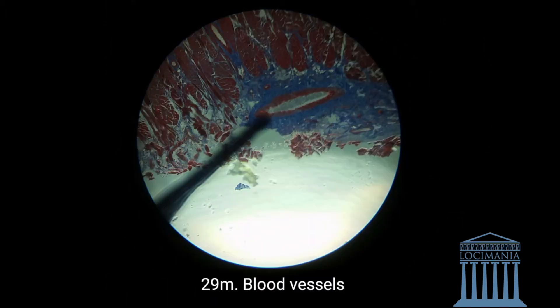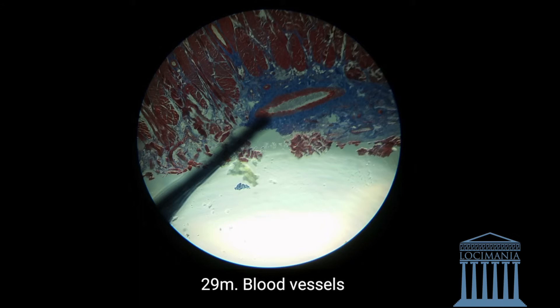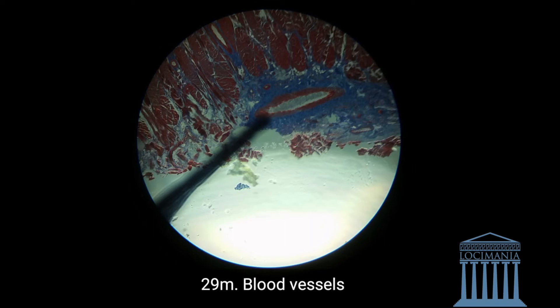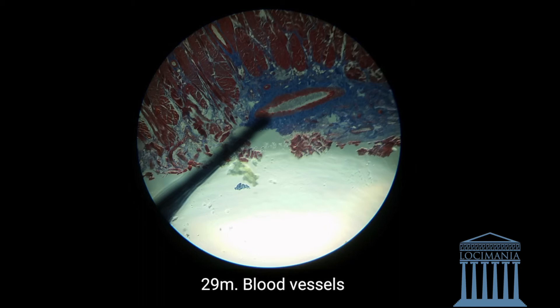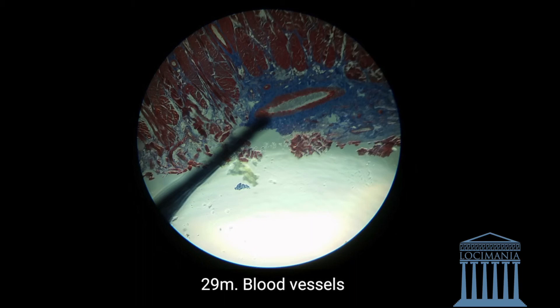Going on, we have the artery here. How do we know it's an artery? If you look closely, we can see that there is muscle around the artery. If there are no muscles, then it's probably a vein. And if there are cuboidal cells, it's a duct. So here we have a blood vessel — it's an artery, distinguished by the muscle cells around the walls of the artery.